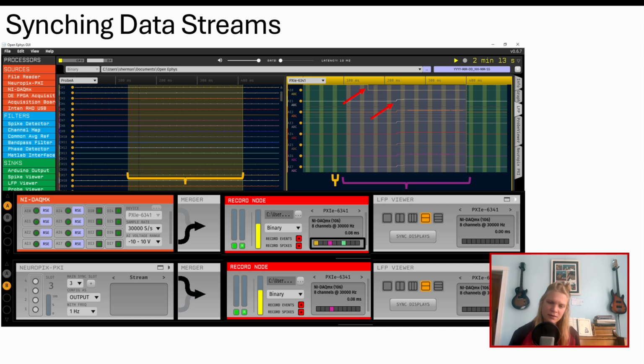Theoretically, we could align these two continuous sources manually now, but better yet, let's get Neuropixels and the NI-DAQ running on the same clock. Use these channel monitors in the record node to make sure the Neuropixels channel is set as the master subprocessor. But if these channel monitors flash orange, don't proceed with your experiment. It indicates something is wrong with syncing. In my hands, it was a sync signal that was too frequent, so now I stick with the 1 Hz signal. The syncing takes a moment, so press play to initialize before you hit the record button.